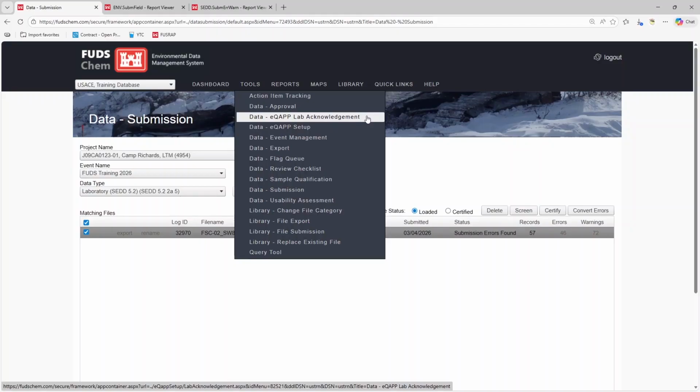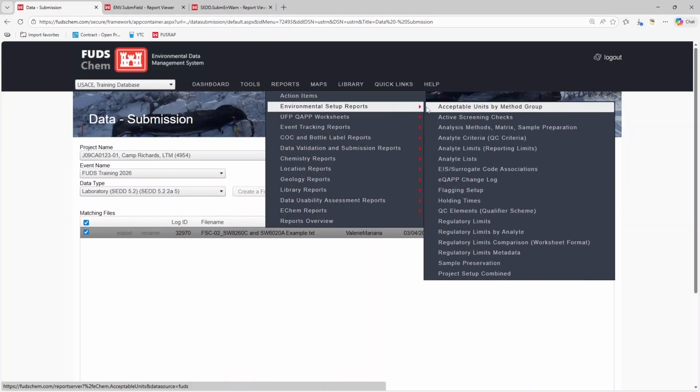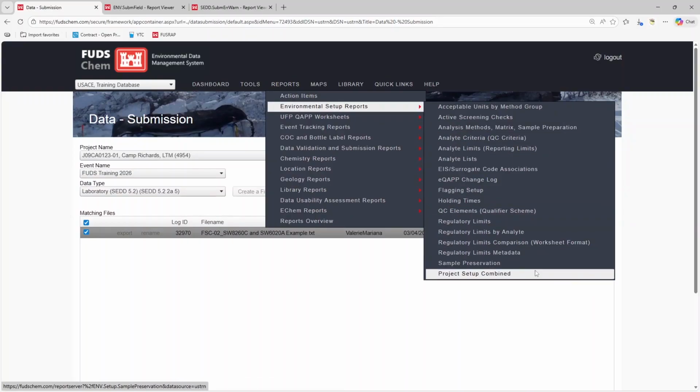If the eQAPP has already been approved, then the lab acknowledgement interface will not list the project. As an alternative, the contractor can go to Reports, Environmental Setup Reports, Project Setup Combined, and export this for the new lab to review. This way, the new lab can see what they will be expected to report. The contractor, or Corps chemist, can optionally add a note in the eQAPP Setup tool, documenting that the new lab has reviewed the eQAPP.